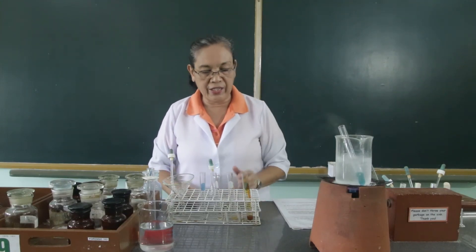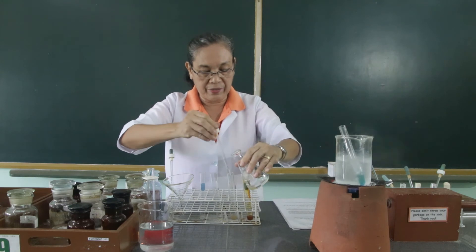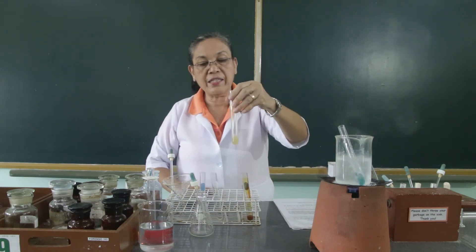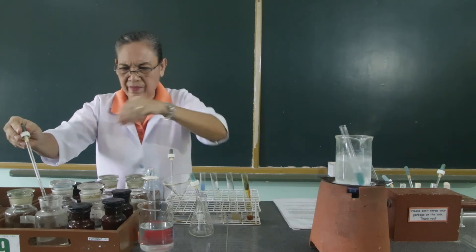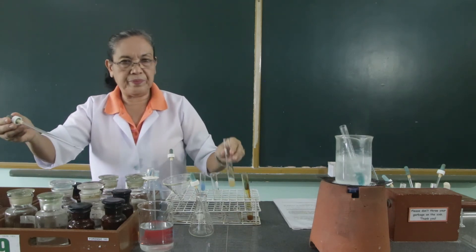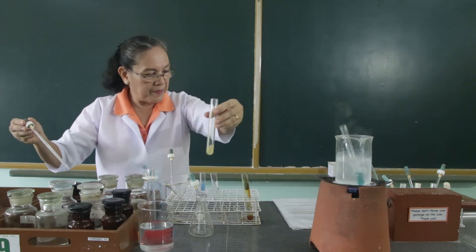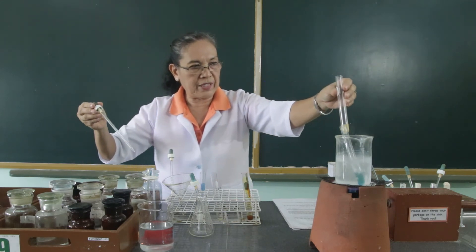For the next reaction, we are going to use 5 ml of the glycogen solution and we are going to hydrolyze this first before we add it with Fehling's reagent — submitting it to Fehling's test. To hydrolyze it, we are going to add it with drops of hydrochloric acid. Then we will boil this for about 10 minutes.